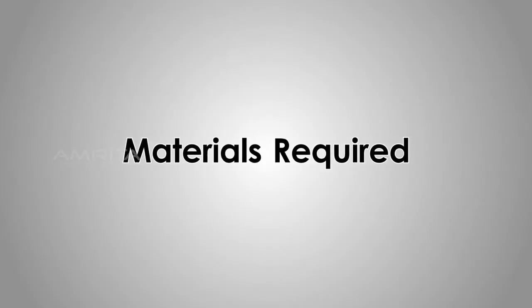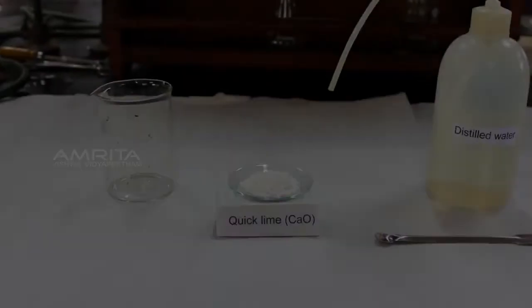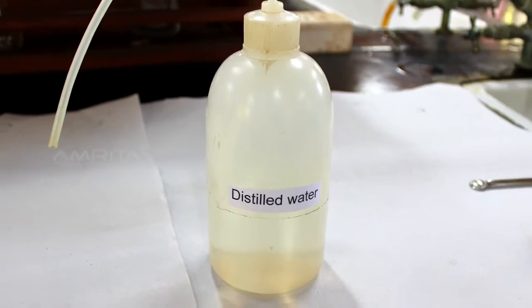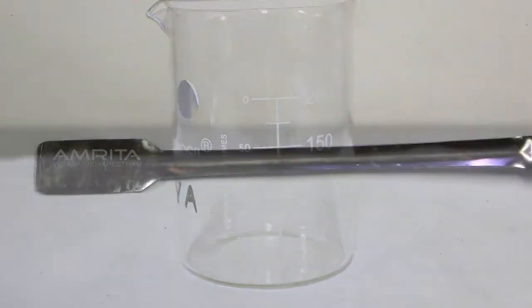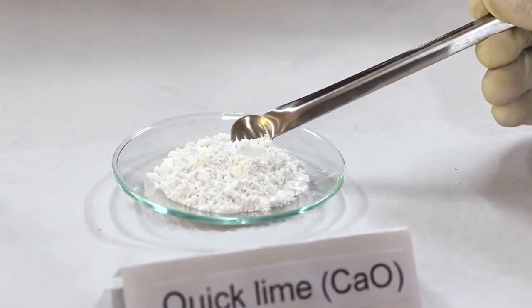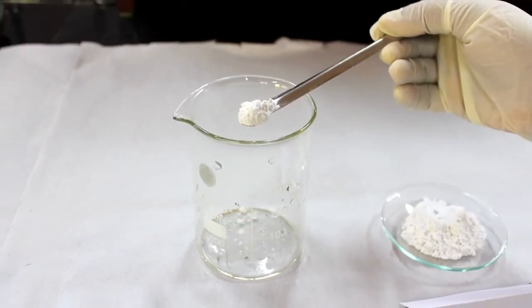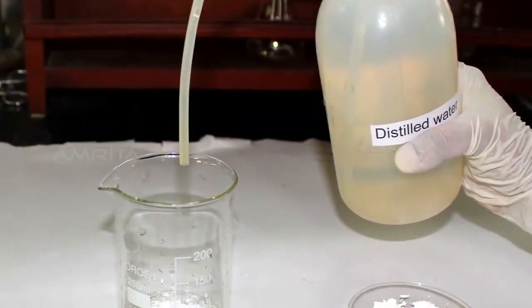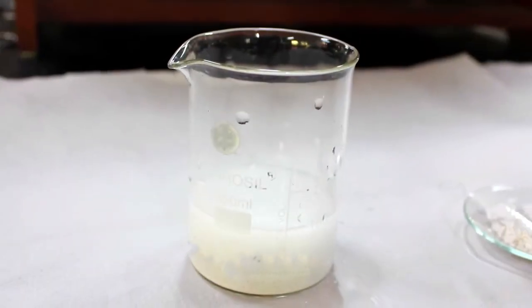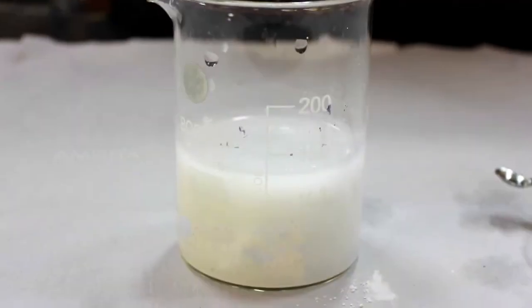Materials required: quicklime or calcium oxide, distilled water, beaker, and a spatula. Procedure: transfer a small quantity of quicklime or calcium oxide to a beaker using a spatula. Slowly add distilled water into this beaker. Pour enough water so that quicklime remains submerged in water.